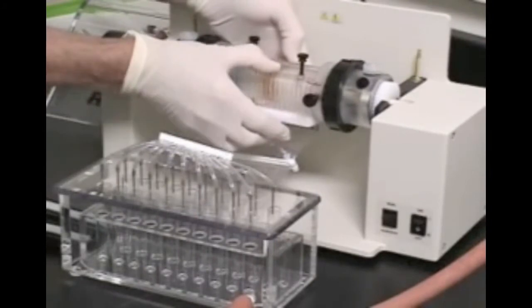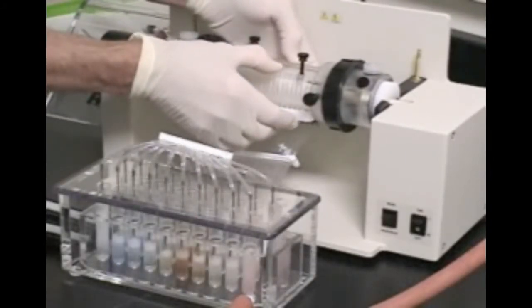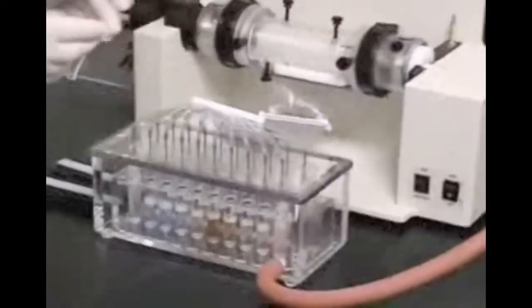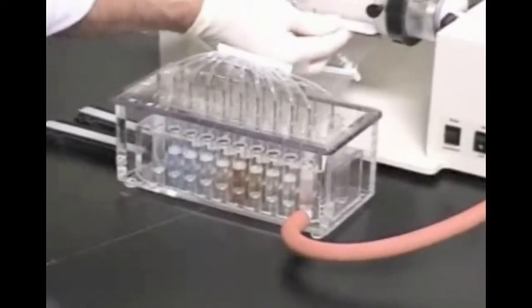All 20 fractions will simultaneously aspirate into the collection tubes. Turn off the vacuum source and remove the test tube rack.